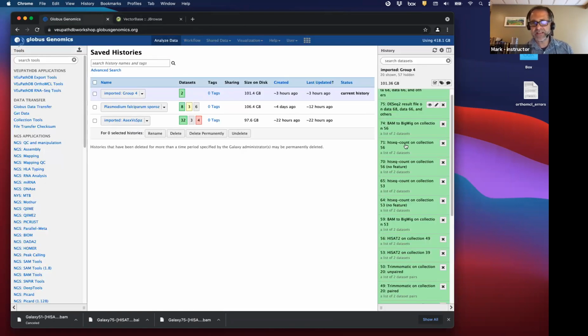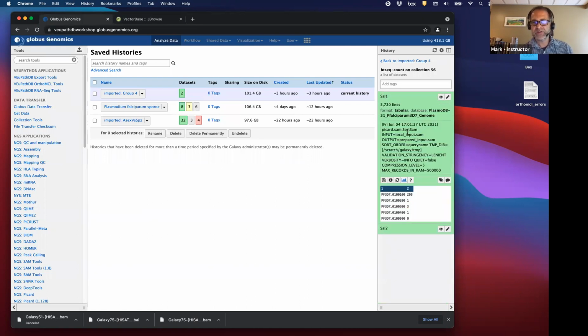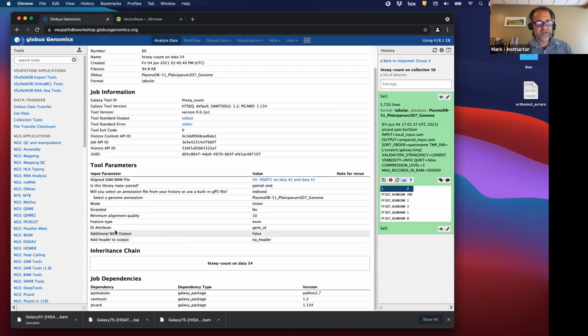So let's just look at that HTSeq-count, one of those. I'm going to first go to this data set, view details, and what you did is selected a feature type of exon, so it counts all of the reads that map to exons. And then this ID attribute, it uses this to sum all exons based on the gene ID. So if you have gene A and gene B, and each has 3 exons, it will add all the 3 exons for gene A, and then add all the 3 exons for gene B. And it will report 2 numbers, one for gene A exons, and one for gene B exons. So that's what we're getting.